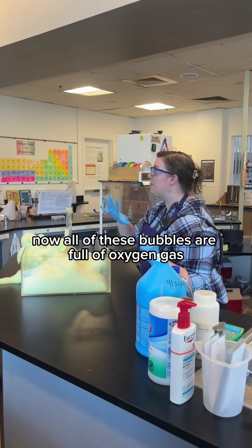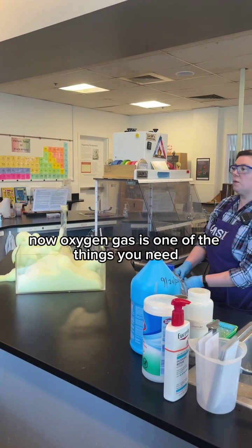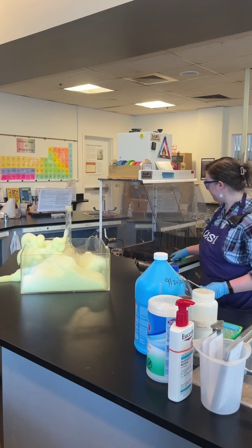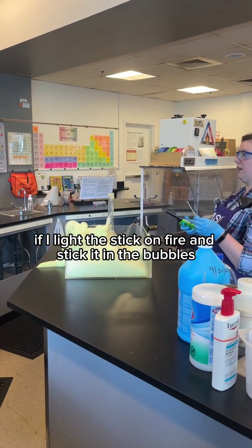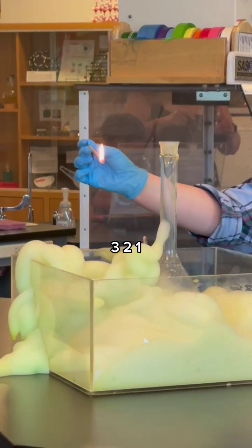Now all of these bubbles are full of oxygen gas. Now, oxygen gas is one of the things you need if you're going to set something on fire. So, what do you think is going to happen if I light this stick on fire and stick it in the bubbles? Ready? 3, 2, 1.